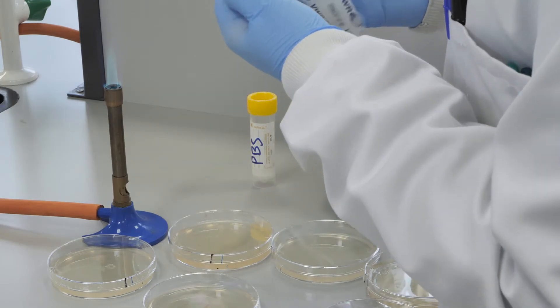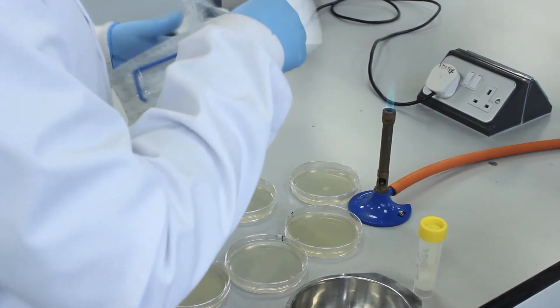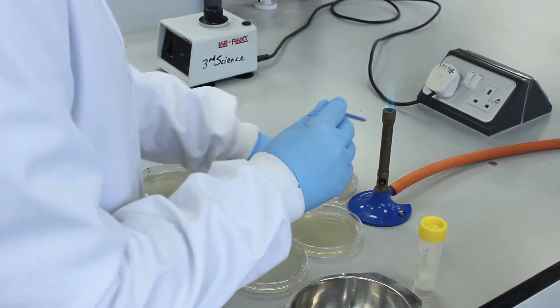Now spread each of the TSA plates, taking care to spread the culture well over the surface of each plate.